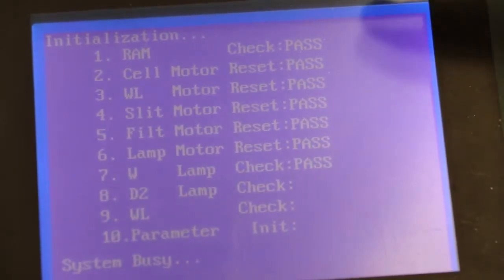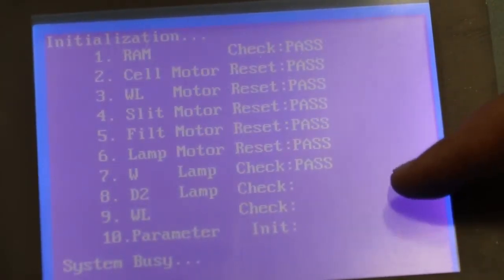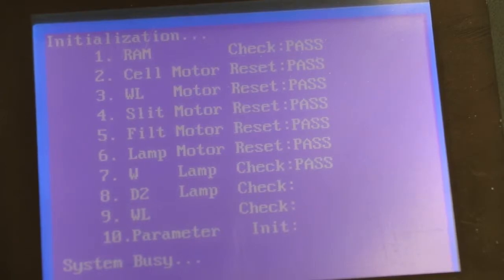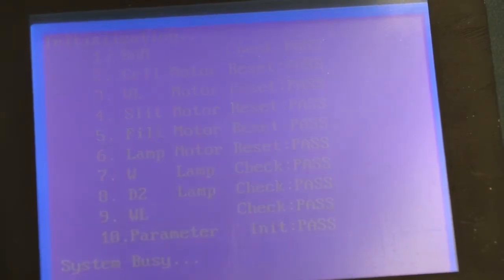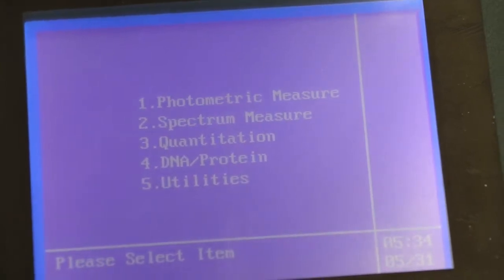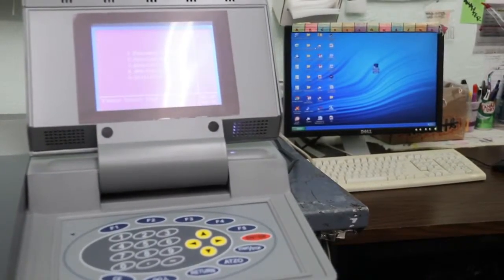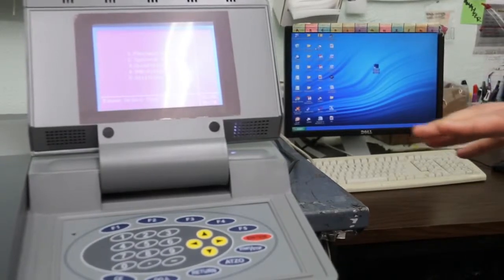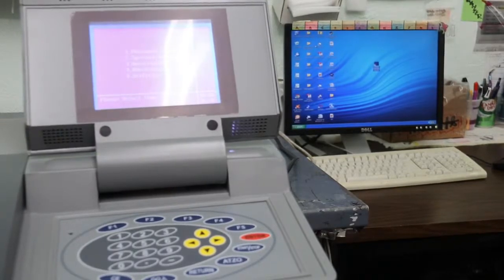During the self-check, each section will show pass. If it does not show pass, there is something wrong with the unit. Okay, everything passed. Now that the self-test has passed, if you want to use the unit as a standalone, that's fine. If you would like to use it with computer control, we will now connect it to the RS-232.